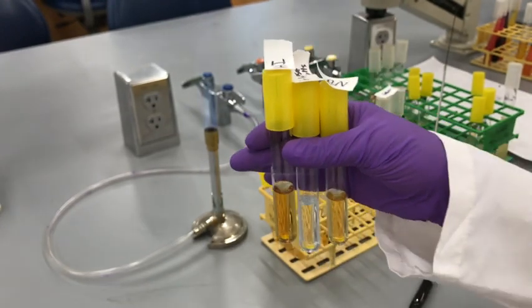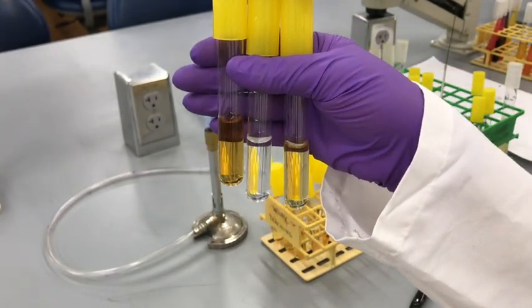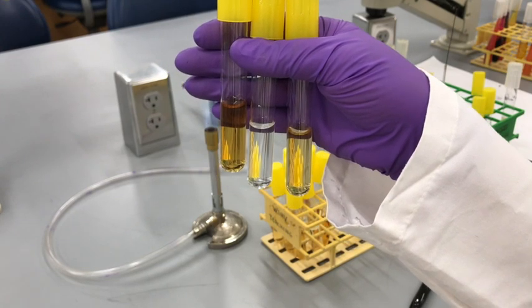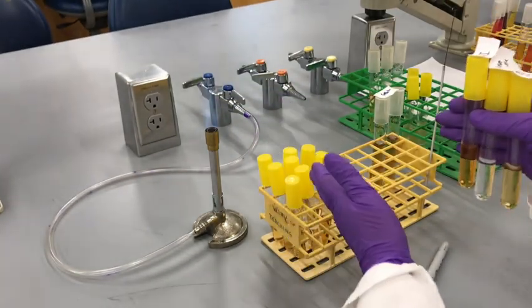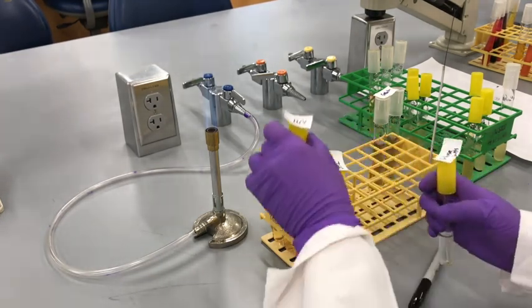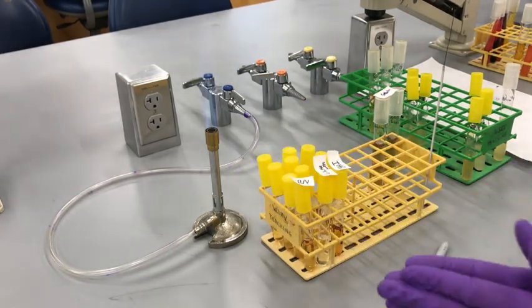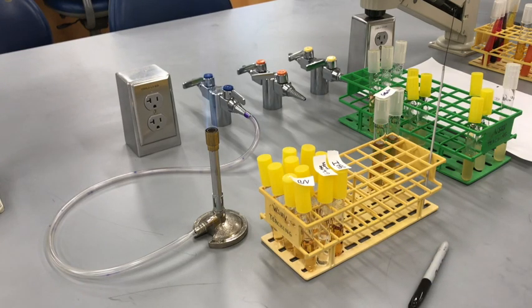And I'm going to inoculate these medias with different organisms. The organisms would be E. coli, Enterococcus faecalis, Staphylococcus aureus. As you can see, there are 4 tubes for each media, and one of them is a control. So you have BHI, nutrient broth, and glucose salts. For the sake of the time constraint, I'm going to label all these tubes, and I'm going to show that after I have labeled it.